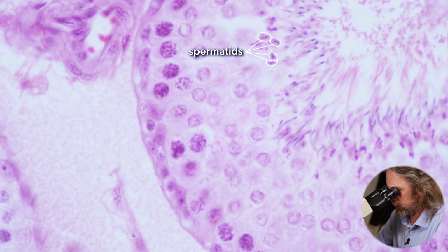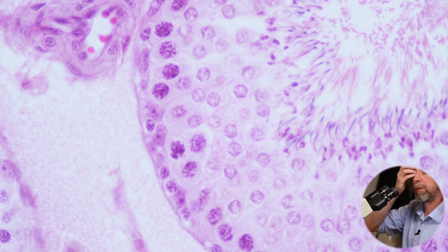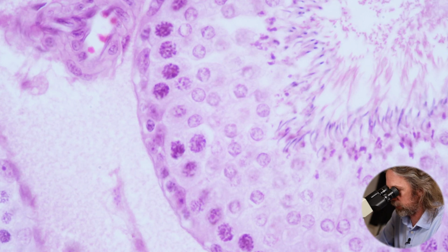So if we look at the spermatids, well, they look quite different again. So again, that dark purple is just staining DNA. And now, it's difficult to tell if there's less DNA or the same amount of DNA, because it's squashed together. It's in a much smaller space, isn't it? So the DNA content is now being packed together tightly as they're going to become spermatozoa and become this very efficient cell that will make its way through the female reproductive tract. So what's happened there?